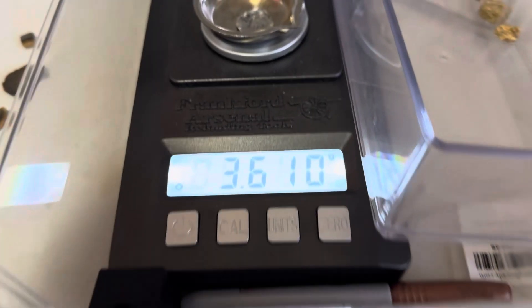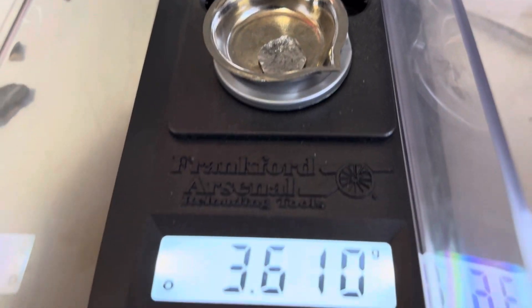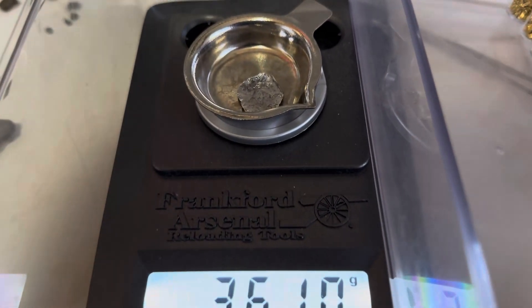That's kind of consistent with the no-collector-metal result — there's still silver in the oxide layer drawn into the cupel. Not going to worry about a few grams of silver on this little experiment. Pretty cool fun little experiment, and that kind of leads us to our conclusion.